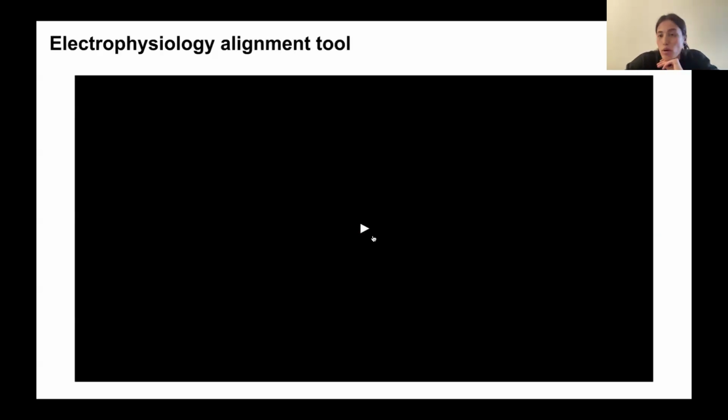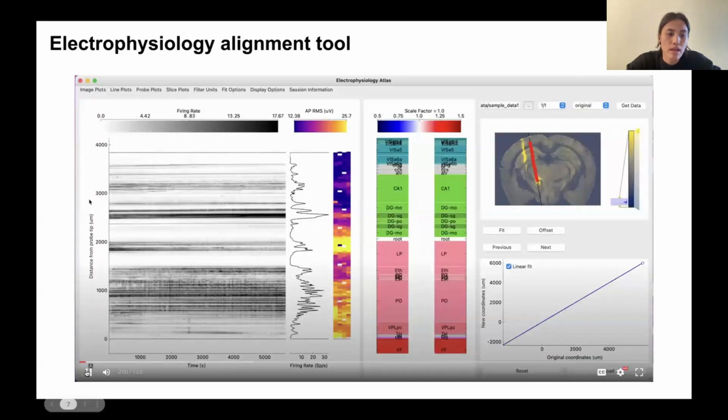So I will now give you a demo of the tool that we've developed at the IBL that allows you to do this. So the basic idea is that we show a number of different electrophysiology plots that you can see on the left-hand side. And then in the center, we show the histology image. So there are two histology areas where the probe passes through the brain. The one on the left, you're going to find as you do your alignment, it's going to shift and move. And the one on the right will stay constant. And this is just so you can reference the original annotation and see how much you've changed things.